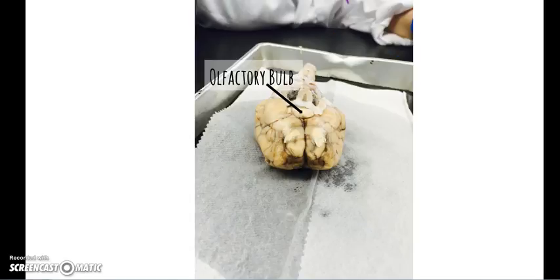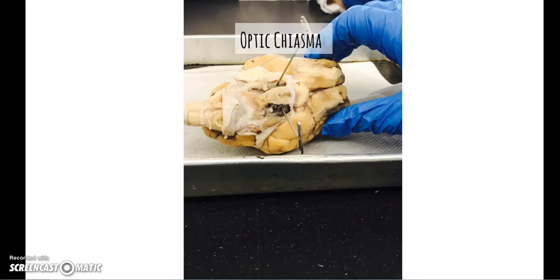Here we have the olfactory bulb. It's located in the forebrain. Its function is to process odors. Here we have the optic chiasma, which is an X-shaped space in the forebrain in front of the hypothalamus.